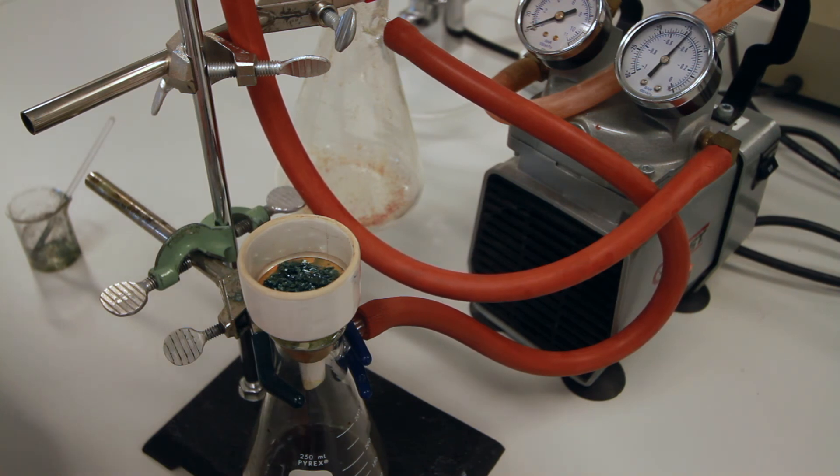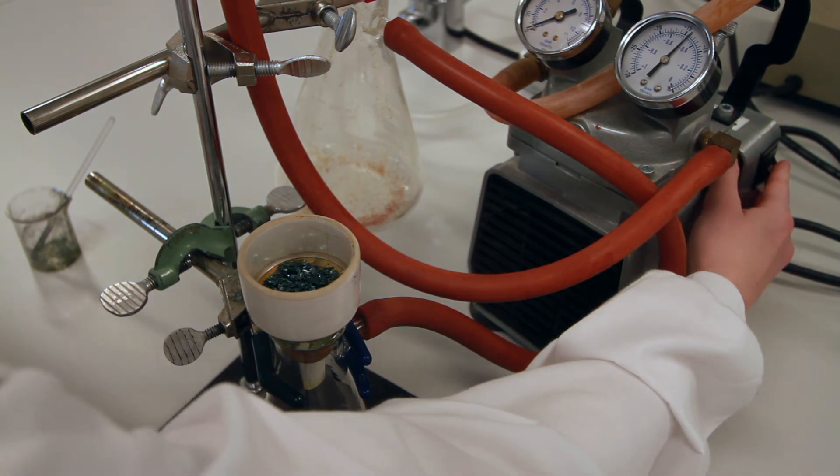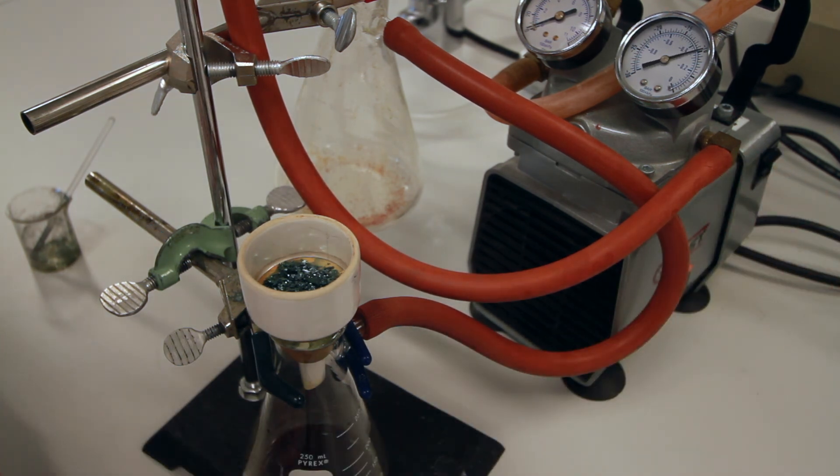When there is no more liquid entering the filter flask and your crystals look dry, turn off the vacuum pump and transfer your crystals.